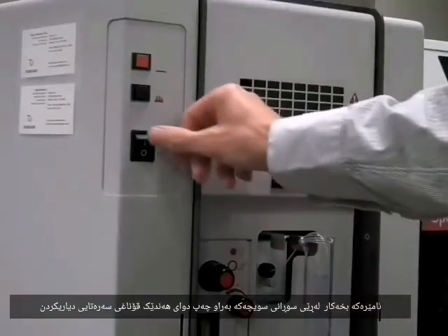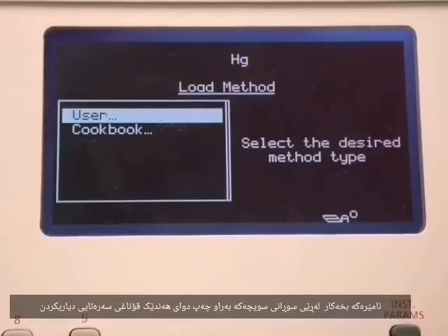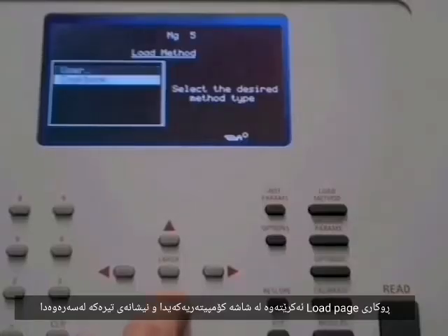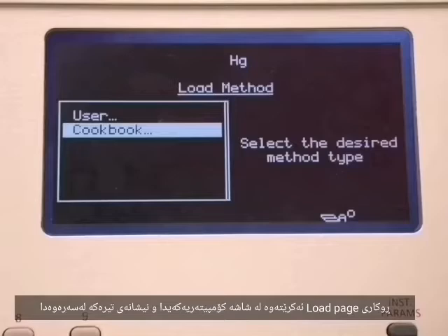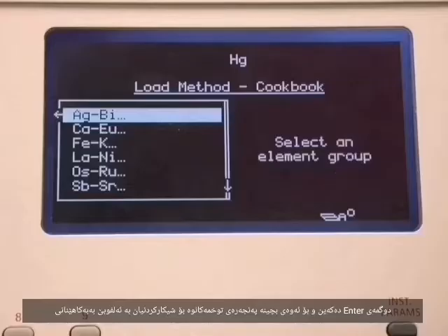Turn on the power for the instrument with the rocker switch on the far left. After some initial diagnostic steps, the load page will open on the computer screen. Use the arrow key to highlight the cookbook. Press the Enter key to proceed to the next window. Elements for analysis are alphabetized using their atomic symbols.